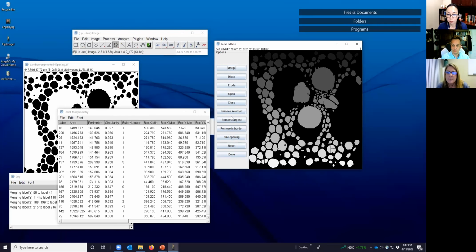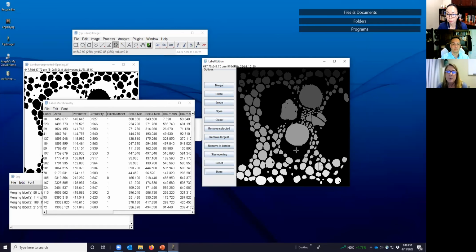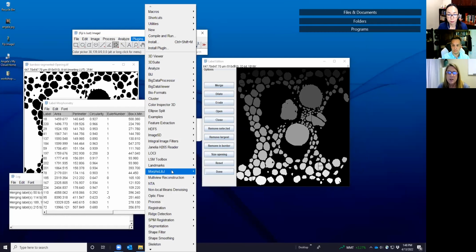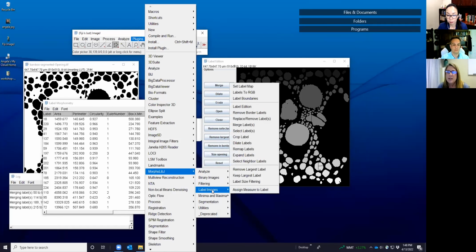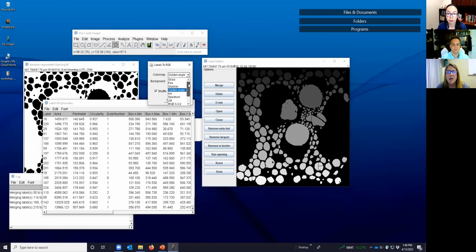All right, so now we have all of this information, and we can export it and look at some distributions of the various areas. Let's say that at this point, what we wanted to do is put this example image into our notebook. Well, this grayscale image isn't so great. Perhaps we want to use a colored image. And it's quite easy to do that with MorphoLibJ. If you go here to label images, you can change the labels to RGB. When you do that, you have a number of different coloring schemes that you can use, like lookup tables.